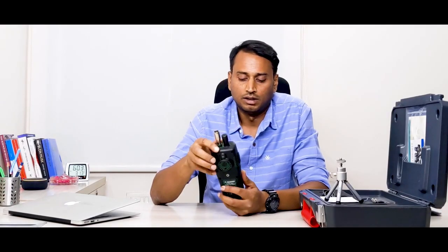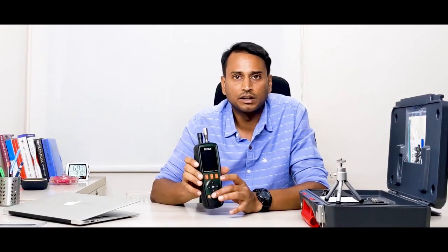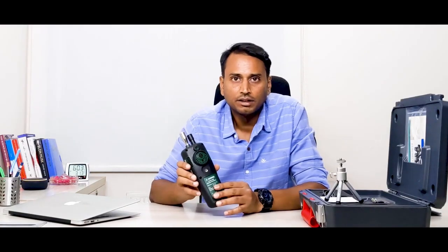At the back you can see there is a camera which can take a continuous recording of 20 minutes. At the front you have several buttons where you can do the settings and view the report for this particle counter. Now it can run with a battery and it can also run with an AC adapter. I am going to show you what is in the supply scope.